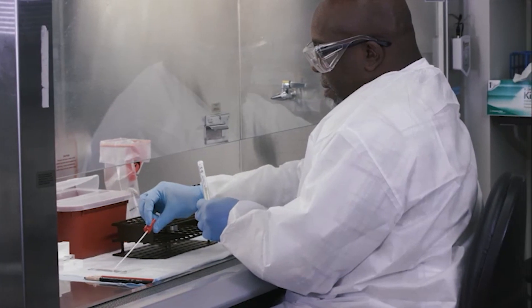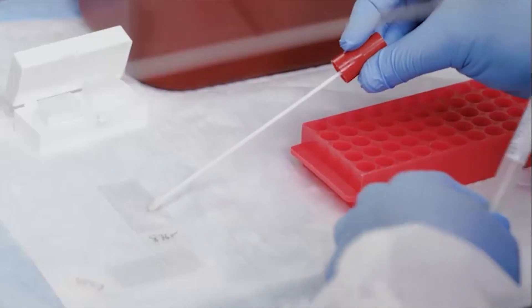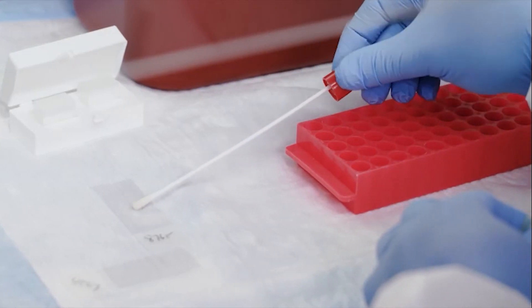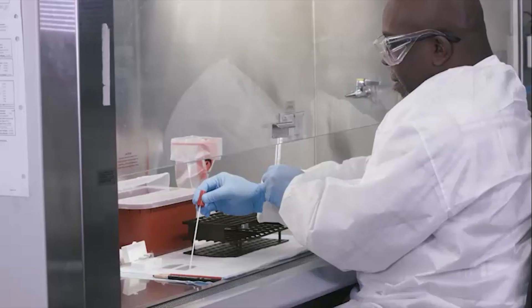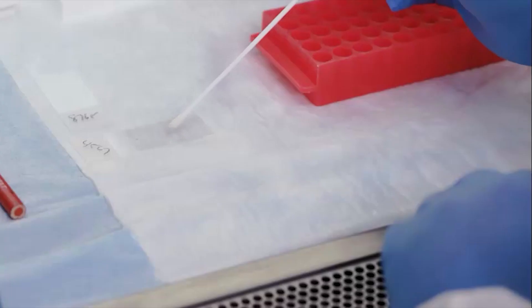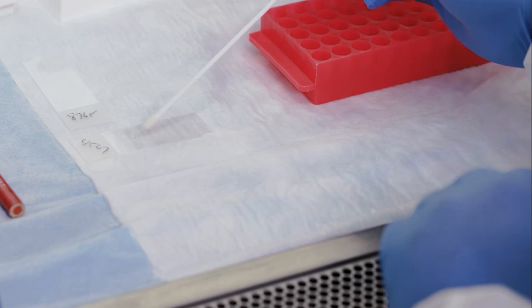Depending on your laboratory's SOP, a swab is either rolled across the clean labeled slide or dabbed on the slide. The slide is then allowed to air dry.